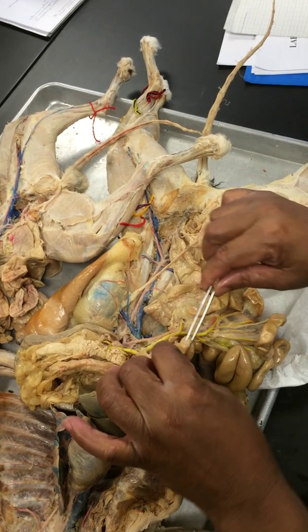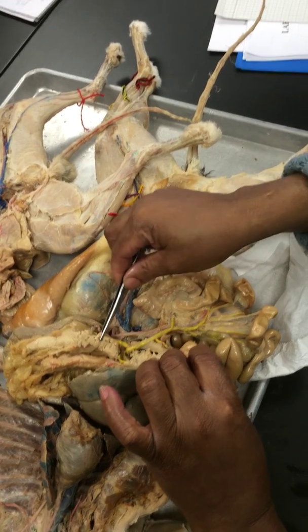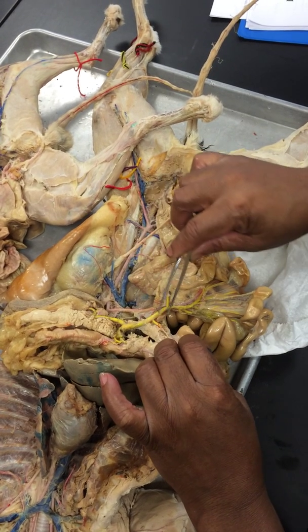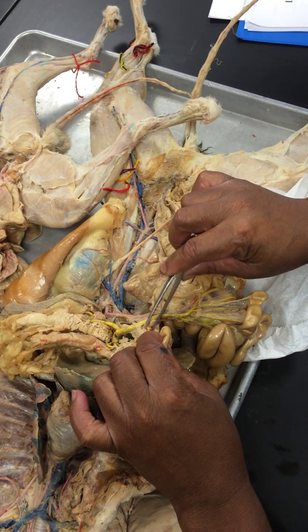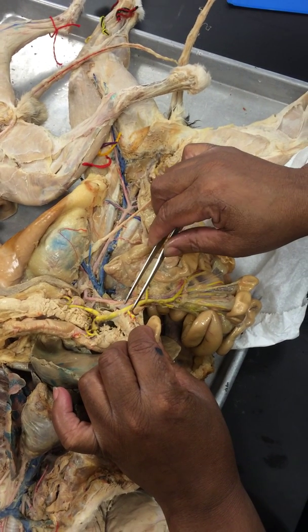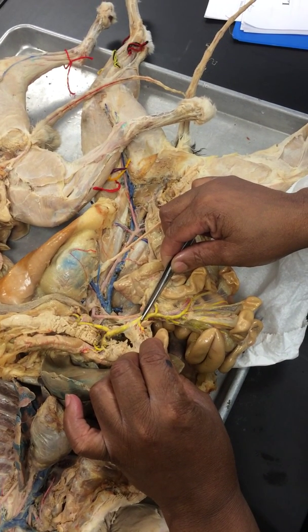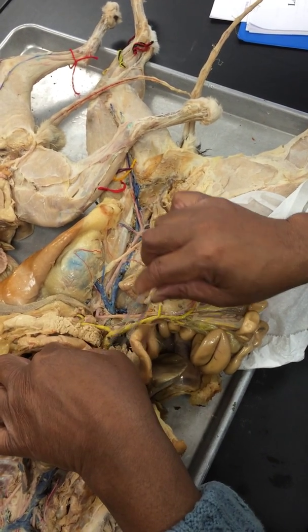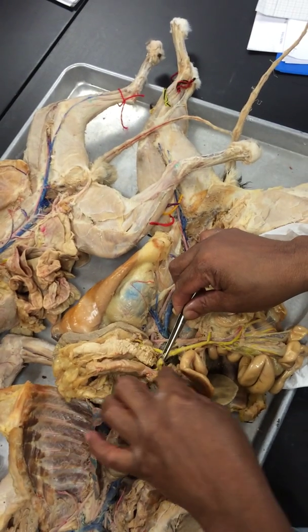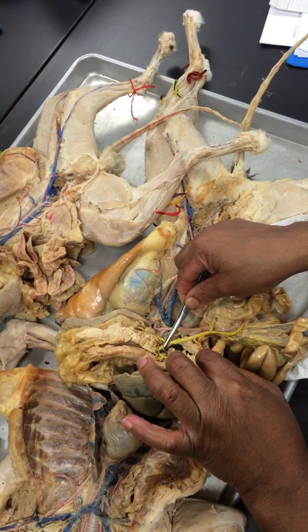Now the duodenum, that C-shaped part of the small intestine, there's the pancreas that's laying in that part. So the duodenum and the pancreas is served by two smaller vessels. This little one here called the inferior pancreatico-duodenal vein empties into the superior mesentery right there. And then this one up here, that's the superior pancreatico-duodenal. It got busted, but this is where it entered into the hepatic portal.